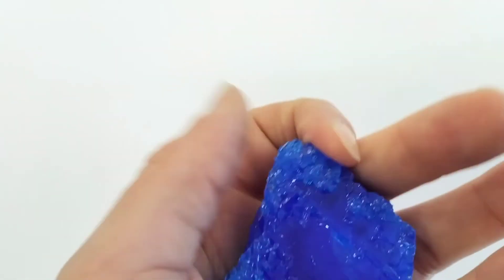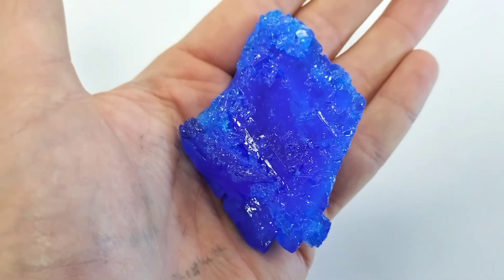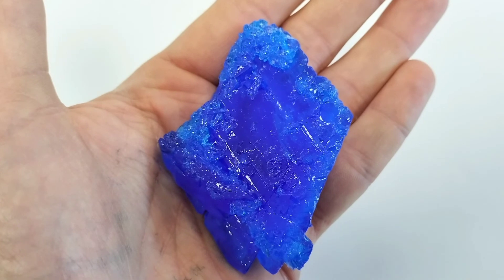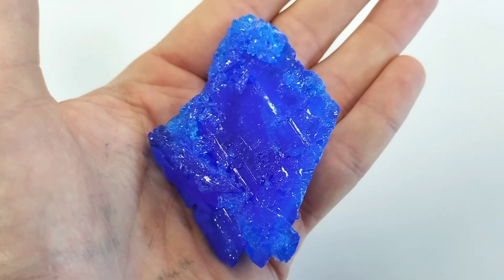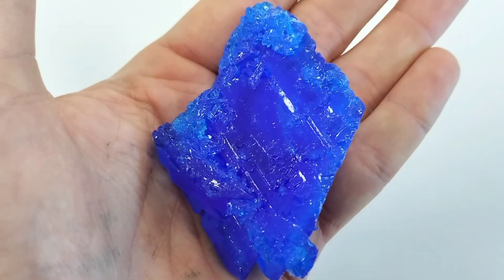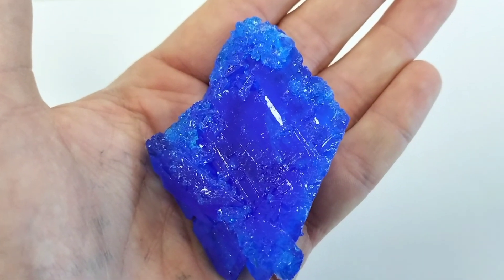If I just pop it in my hand here, you can get an idea just how large that crystal is. Here is the crystal against the size of my hand and it really is massive compared to our original seeding crystal. I'm going to grab the seeding crystal in a second to do a direct comparison, which will really emphasize just how large this crystal is and how much it's grown over that one month period.